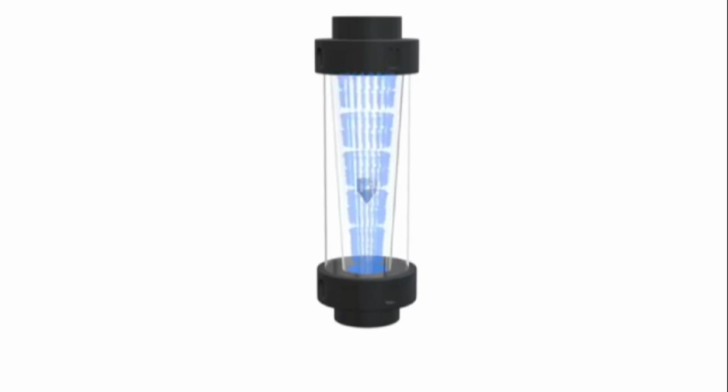When fluid flows through the rotameter, it enters the tapered tube at the bottom and the float rises with the increase in flow rate. The float reaches a point where buoyancy forces are equal to gravitational forces and it remains in equilibrium. The tapered tube is calibrated and the readings are taken from the scale provided on the outside of the tube. The scale generally has units of volume per unit time.